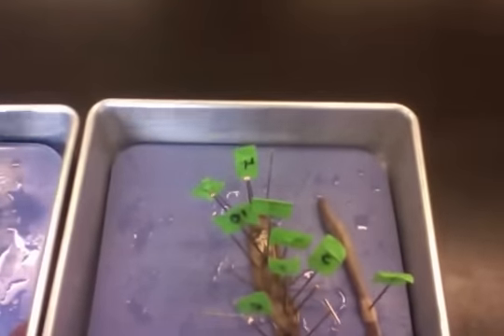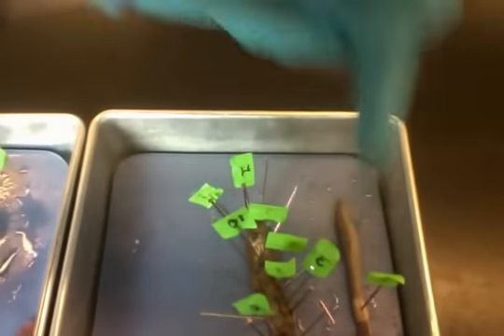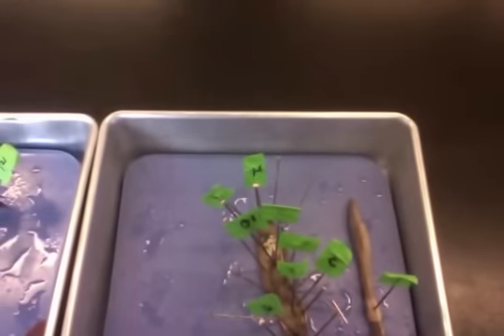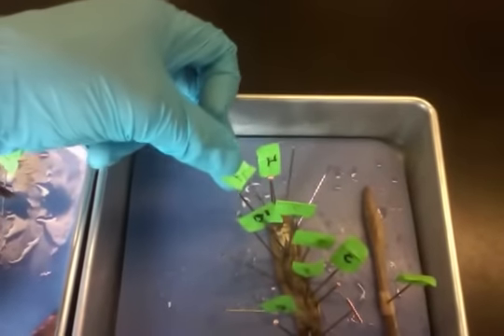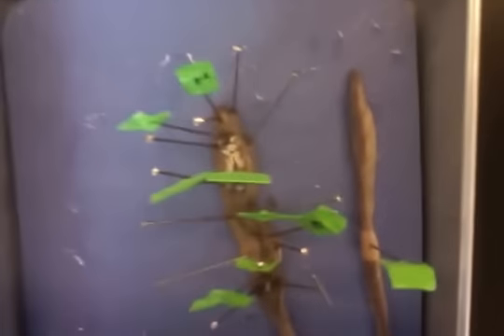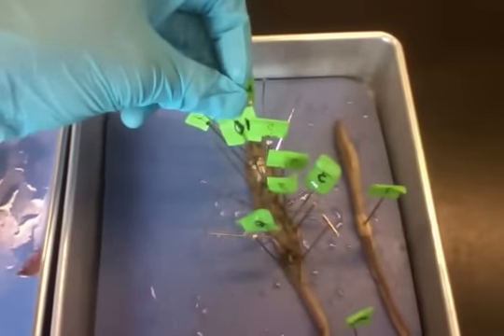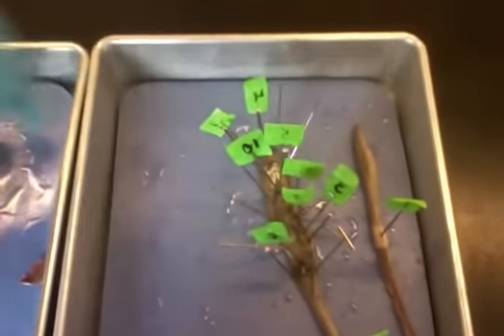And finally, we have the earthworm. This white region on the exo part of the worm is called the clitellum. End is the anus. Looking in the interior, we have the pharynx. We have 9, the hearts, as you see. Going down here, we have the dorsal blood vessel as well as the intestine.